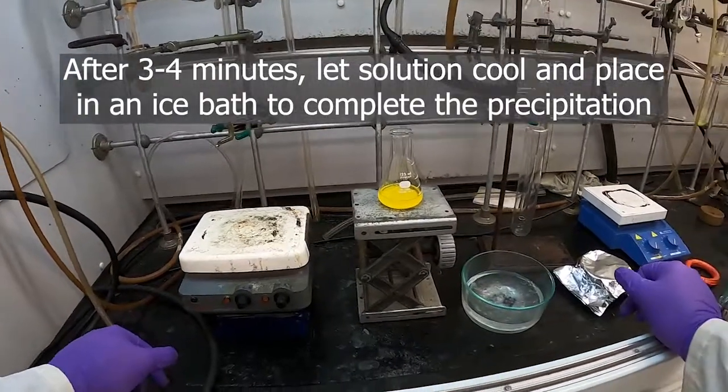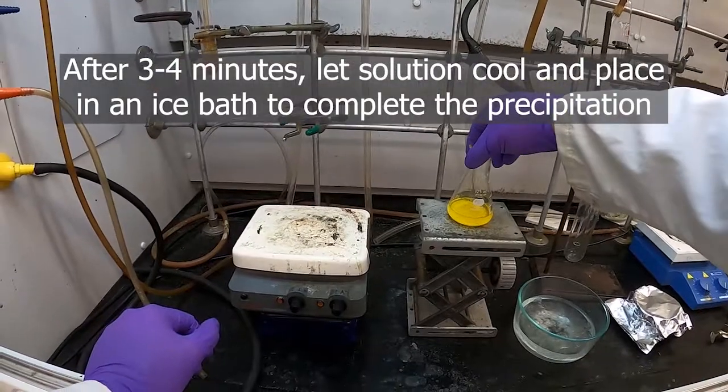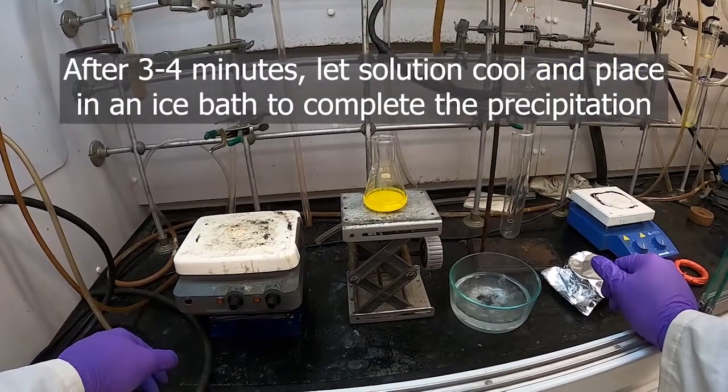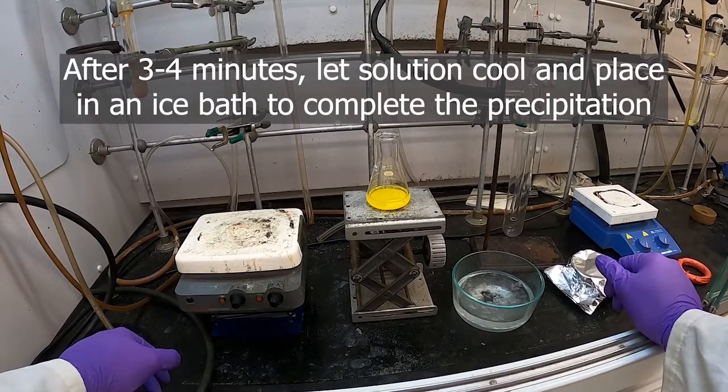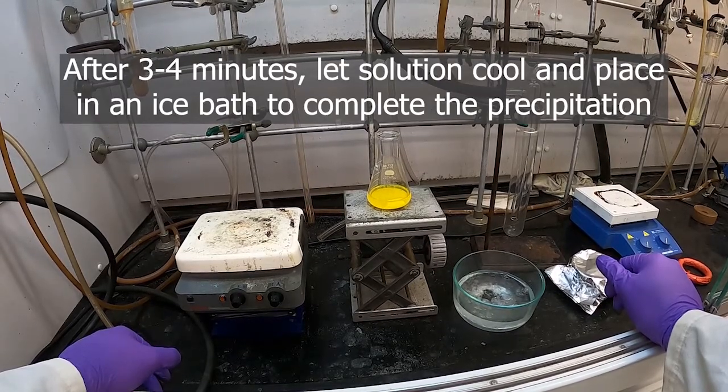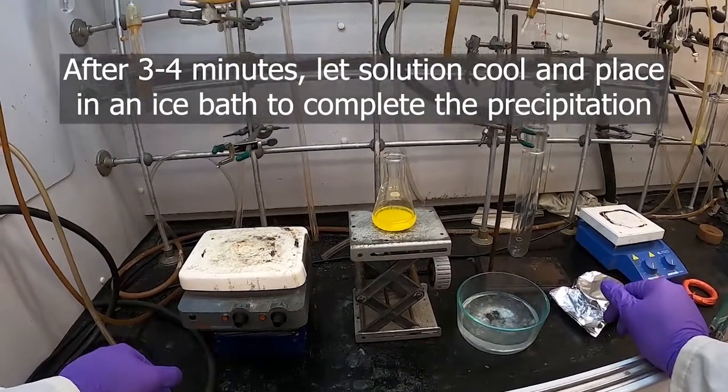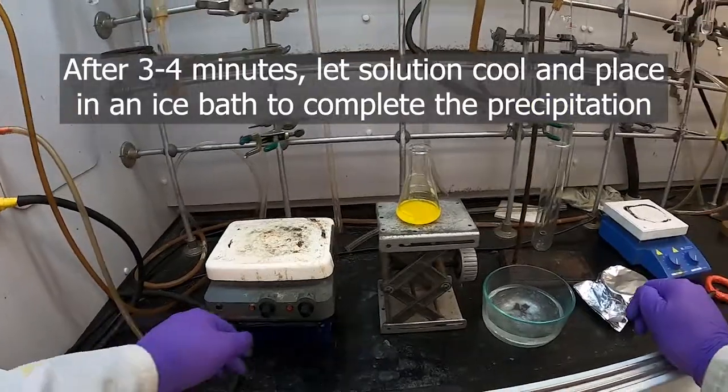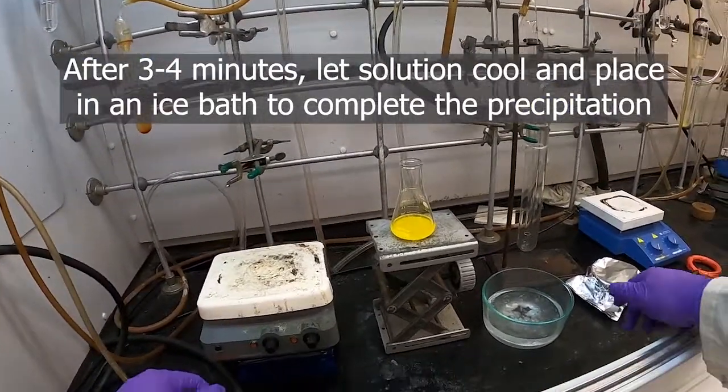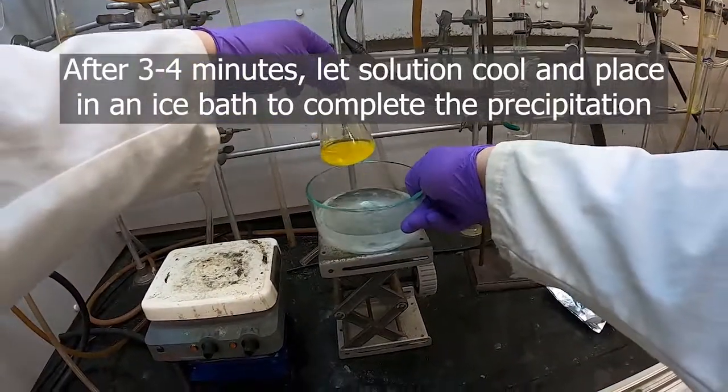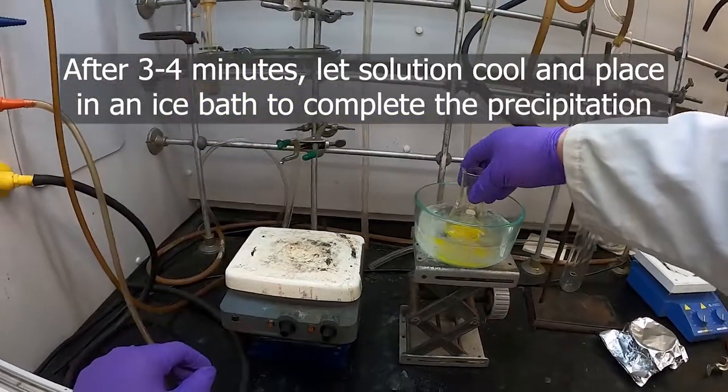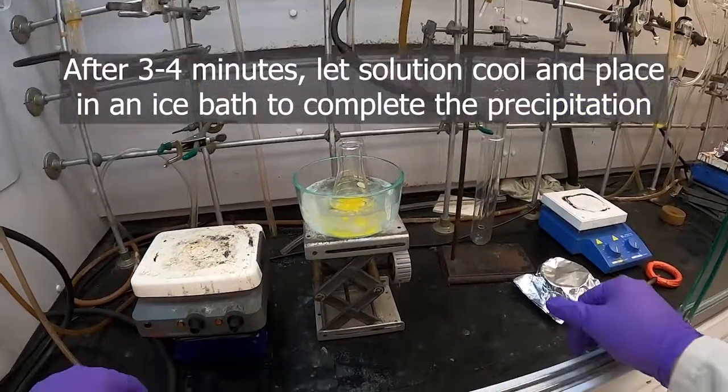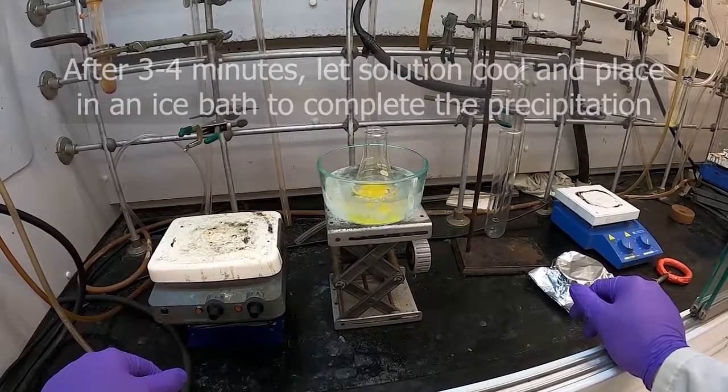My ice bath right here, ready to go. Just let that cool down just a little bit first. Put that in the ice bath here, cool down, and we'll be back in a few minutes when we're ready to filter it off.